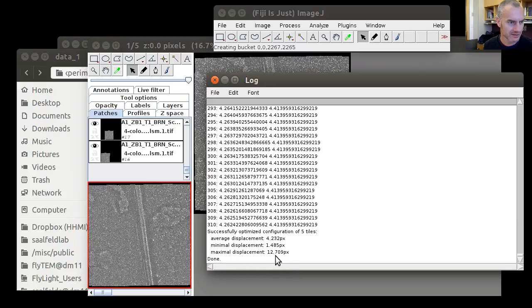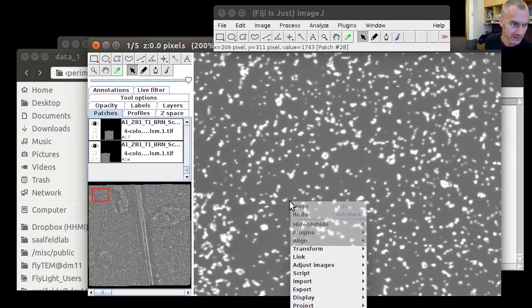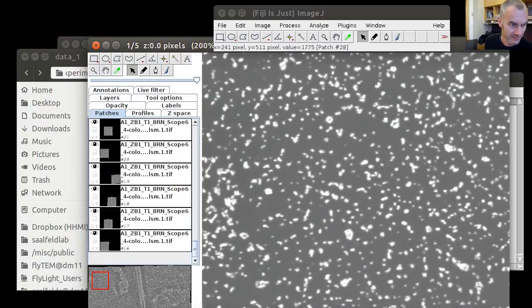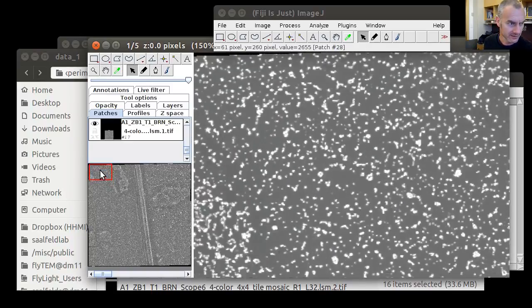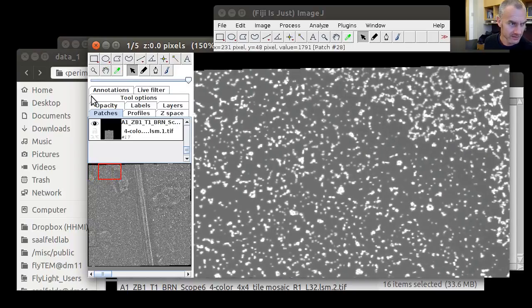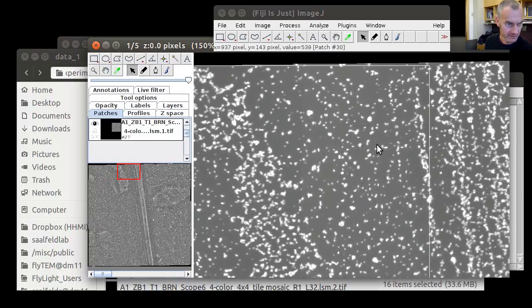So we see pixel transfer errors that are higher than what we had before. So now let's, first of all, reduce the field of view, auto resize, canvas layer set again, and then as a first thing, let's go into places where tiles are overlapping each other, and then by bringing them to the front or back, we can compare them to overlapping regions. This doesn't seem to work right now. Not exactly sure why.